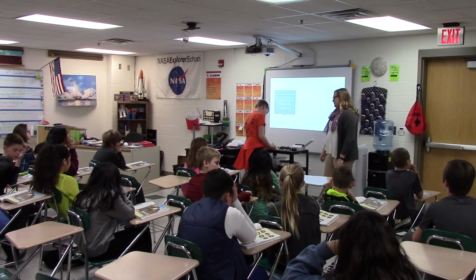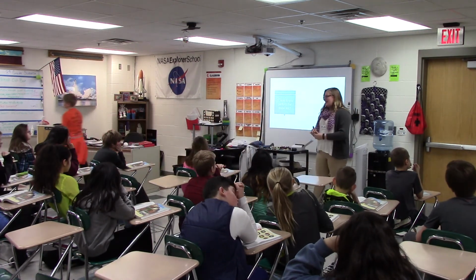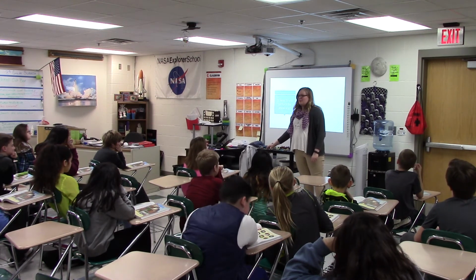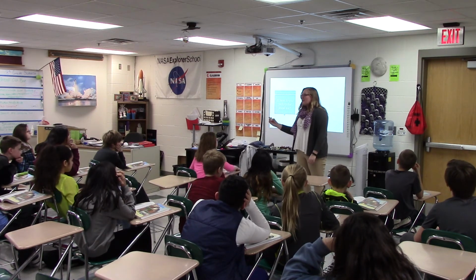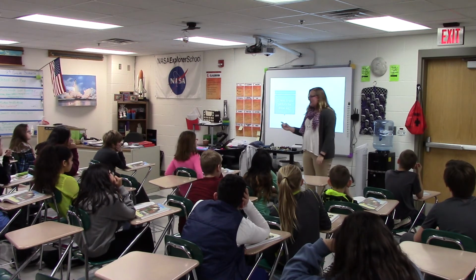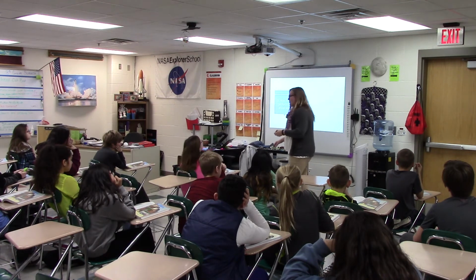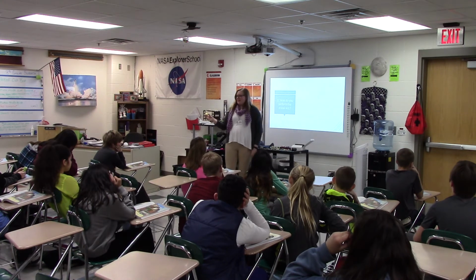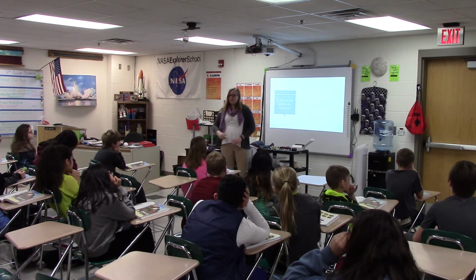Yes. Alright, thank you. So first, Mason left his porcelain plate down on the surface of the table. Make sure you're doing that because, like the glass, if we hold these in our hand and press really hard down on them, they can also break. So for this first one, he started off with the white porcelain plate. That worked out. But this sample right here, he started out on the white porcelain plate, it didn't show up, so then he went to the black porcelain plate.